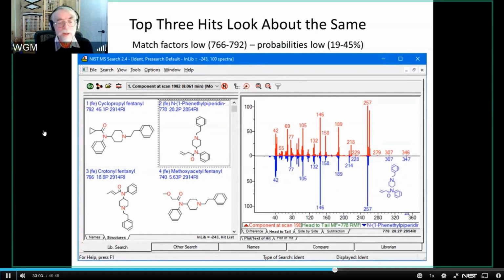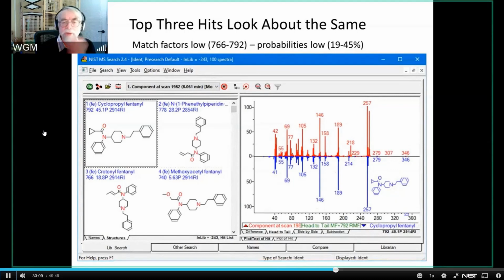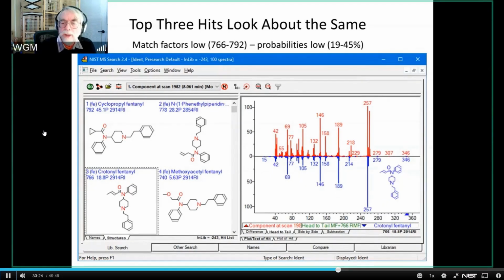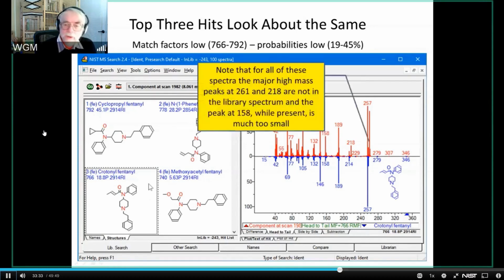If I look at the second one, you see, and if I look at the third one, you see. And in all cases, you see 2 things that are very prominent. One is that none of them explain this very large high mass peak at 261. And none of them explain this peak at 218. And none of them really have 158s that are very good. So all 3 of these spectra are missing major high mass peaks, which is why, in effect, they have match factors below 800.